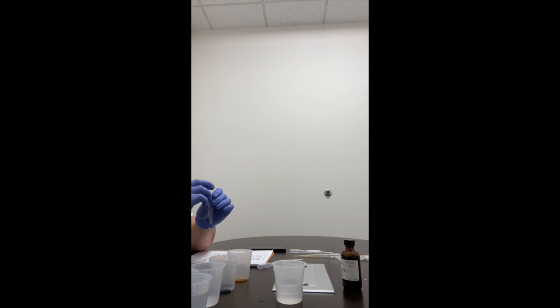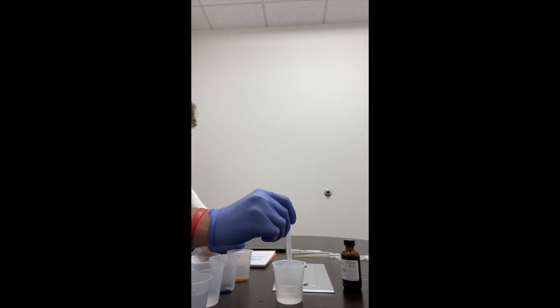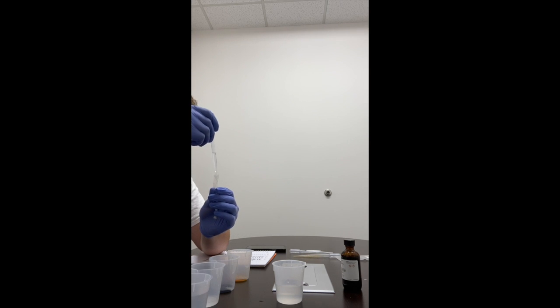Finally. So we'll take a pipette and we'll fill it. Let's see, dry off outside of the dialysis tube. Did that, and add a small amount of water in the bag to examine the rubber band to see if it will hold up.